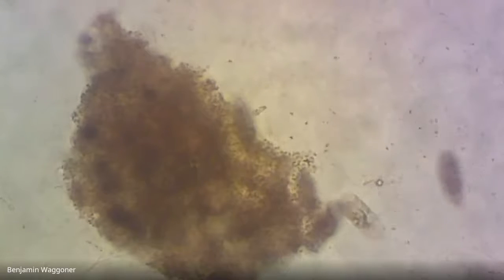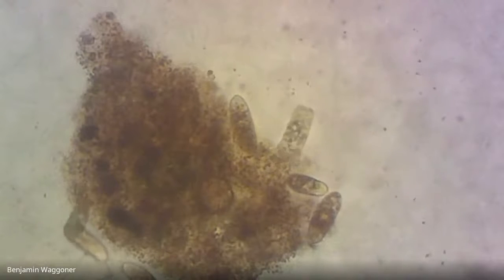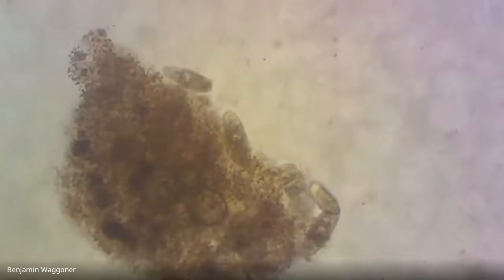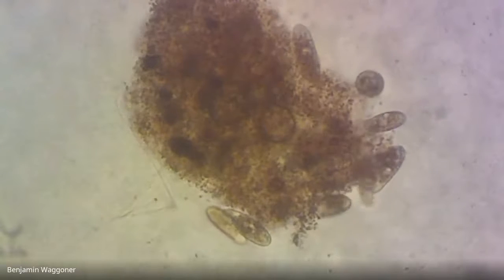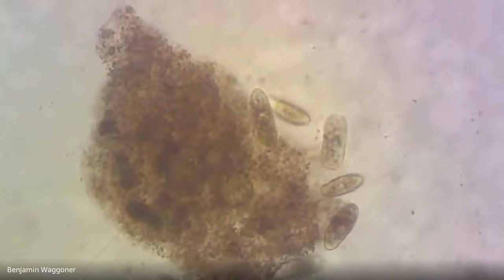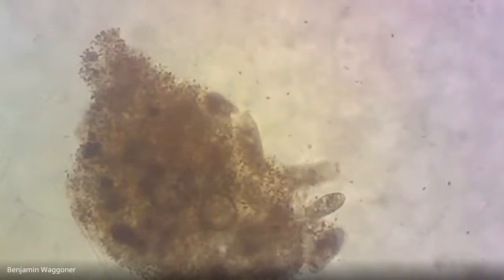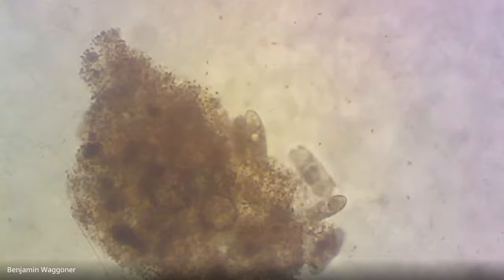It looks like we've got two species now. We've got several that are kind of rounded on both ends, but there's one right here in the middle that's actually got kind of a squared off appearance on one side, and I'm seeing him right up there at about my 10 o'clock. There, I've got him centered right there. Do you see that the front end is kind of squared off? Maybe a little rounded, but not tapered the way it is with the others.